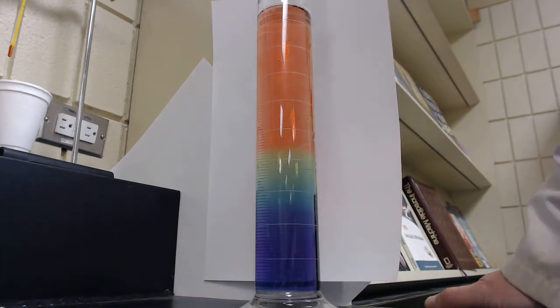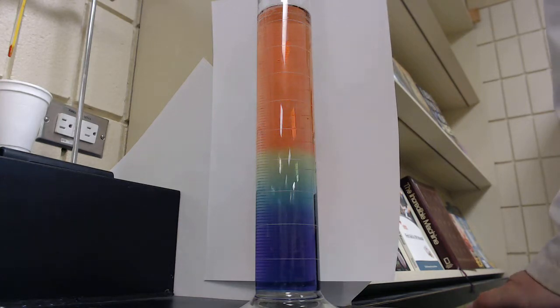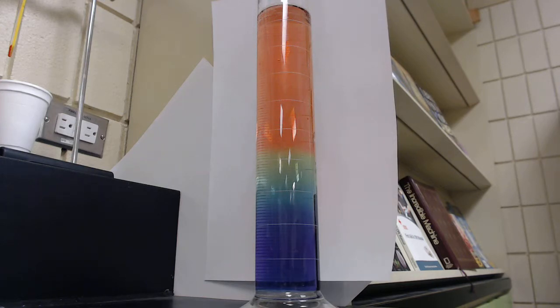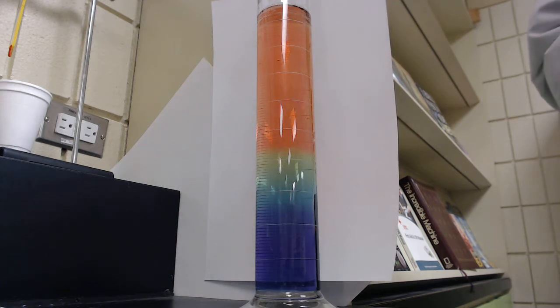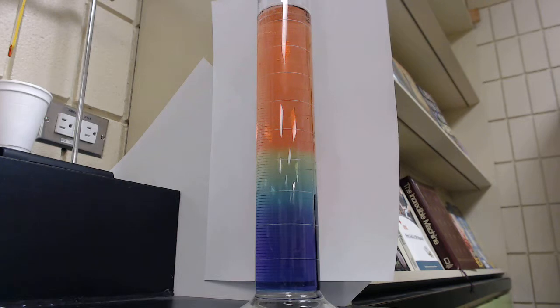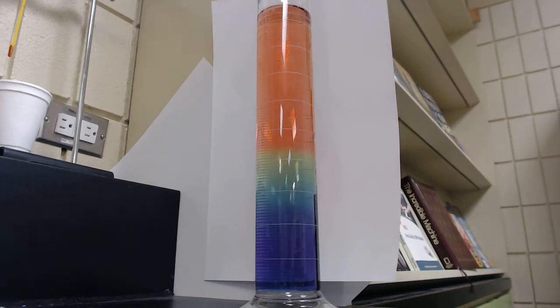Then we get into our results and observations. For this lab, for your results I want to see a picture or diagram drawn of the rainbow coloring — that'll be your results. The observations will be a nice list of what we observed. When we get to the final part of our lab report — the discussion — that is where we discuss our results. You should have various observations and in your discussion you discuss each of those observations and why the chemical changes happened.